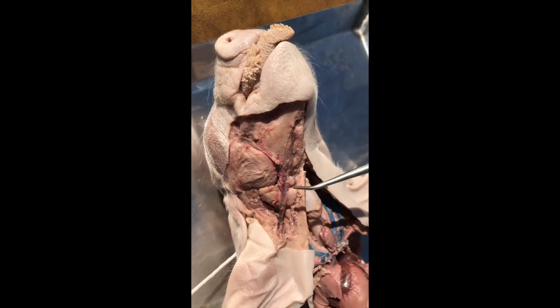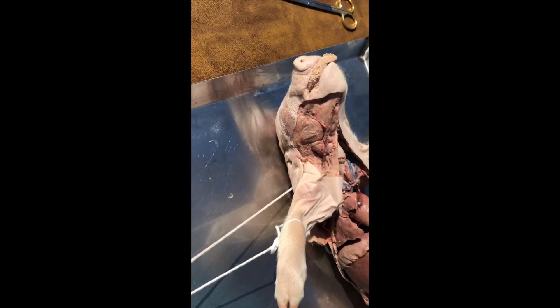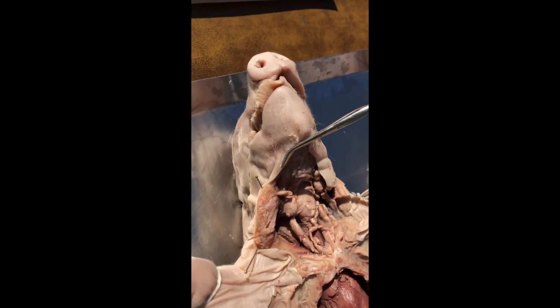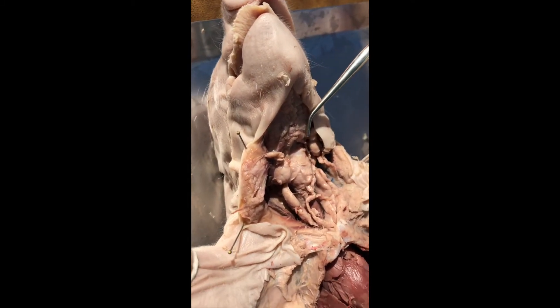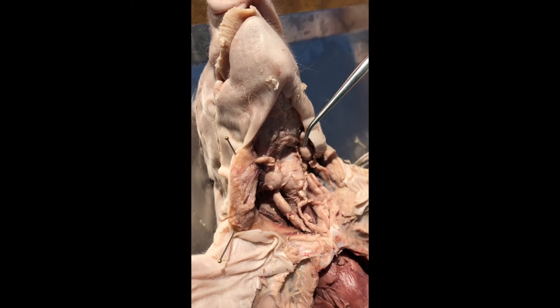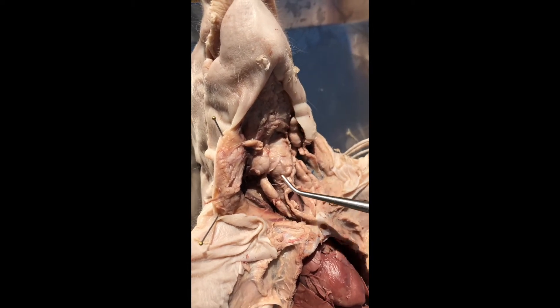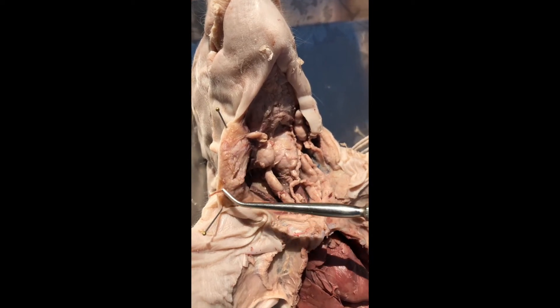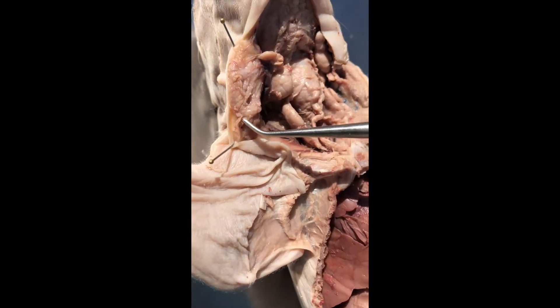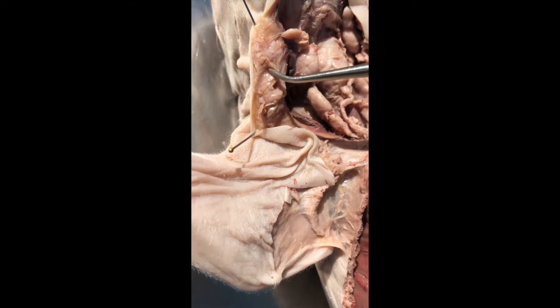Now if we come over here, we get another view of these glands. Over here on this pig, the skin was not removed, but the neck is partially dissected. In the process of partially dissecting the neck, we exposed — there's that parotid gland — and you can see how you've got to be pretty talented to get the skin off the parotid gland.